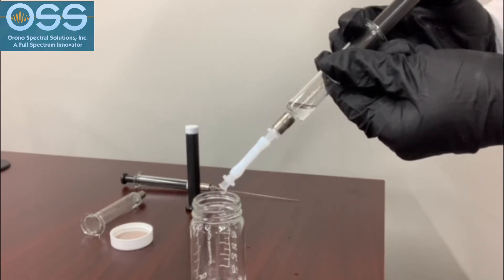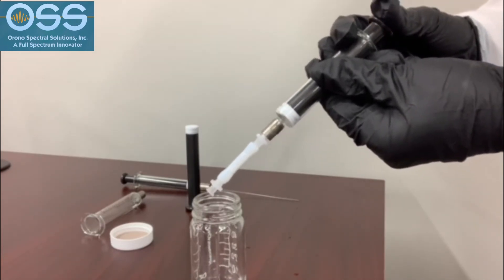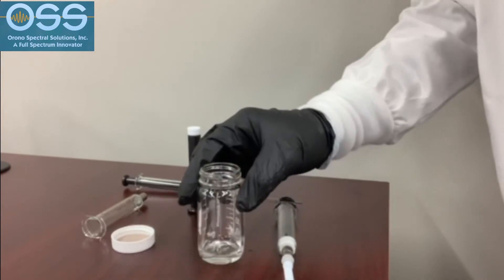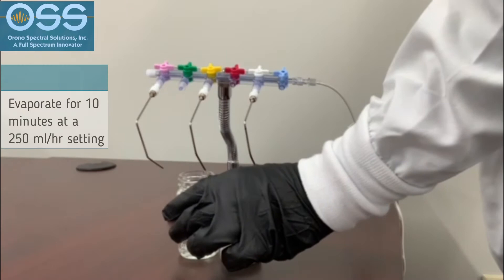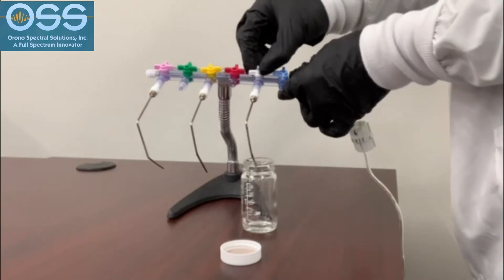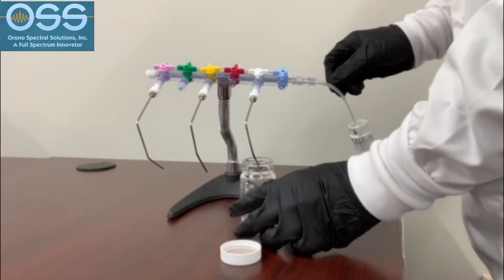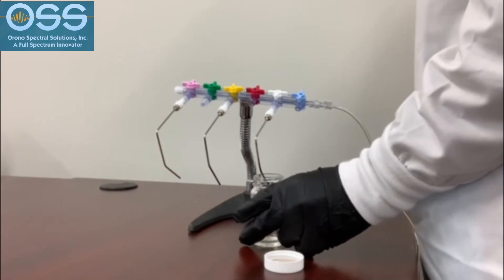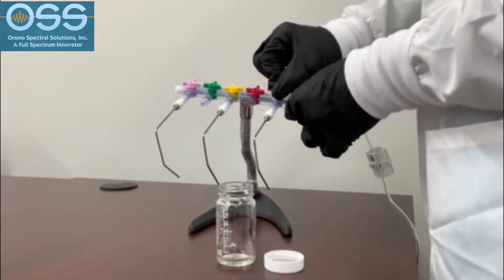Once completed, you have now separated the polar and non-polar portions. The non-polar portion and solvent are now ready to process. At this point, we will evaporate the solvent from the 50 milliliter jar using oil-free dry air for 10 minutes. The volume controller setting should be 250 milliliters per hour and should not create a splashing of the N-hexane in the glass jar. The sample is ready for the next step as soon as the solvent has evaporated and all that remains is the oil portion.